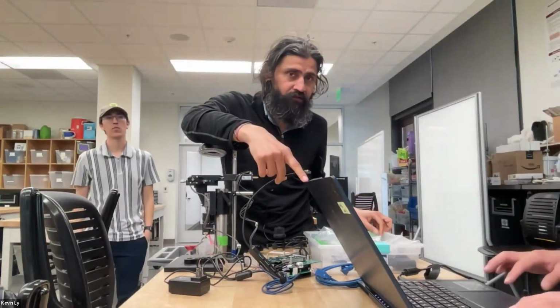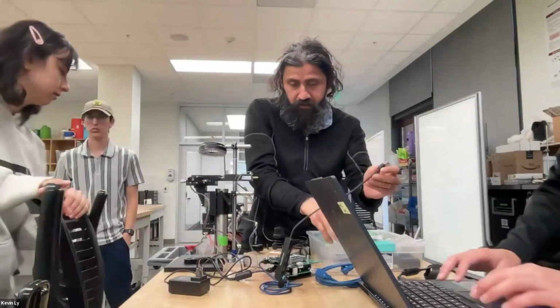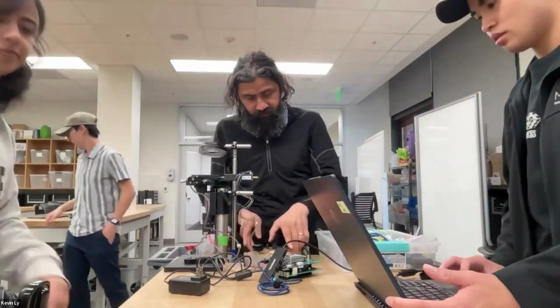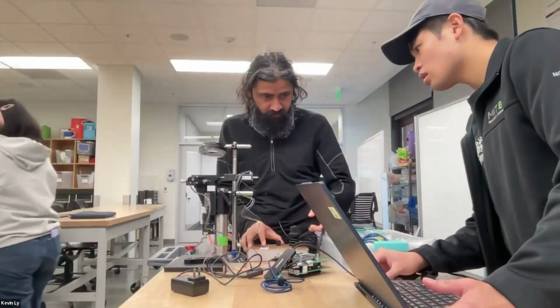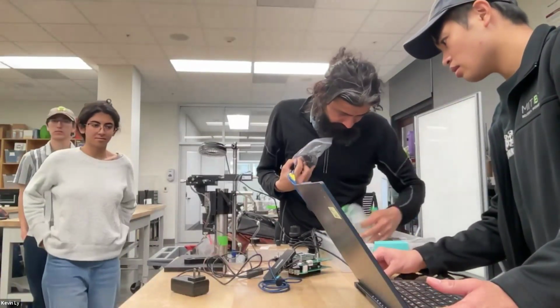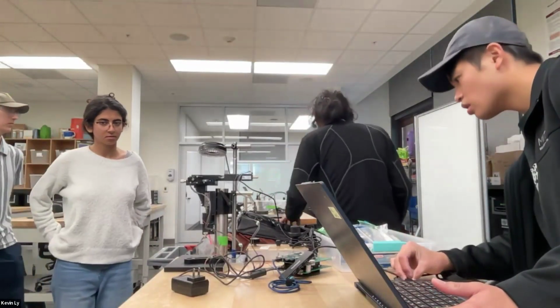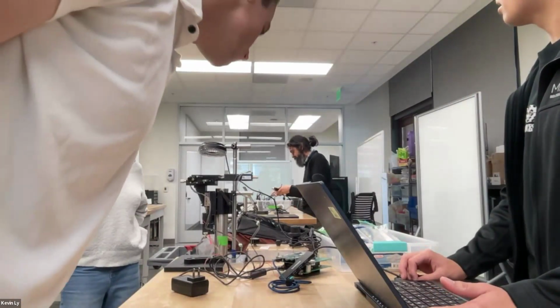Was this the computer next to it or no? Yes, Ben said it works. Yeah. Okay, so then try connecting that per se. And one of the things we're going to do, and the objective is missing. Yeah, so you can just connect that for a second and I'll drive it.